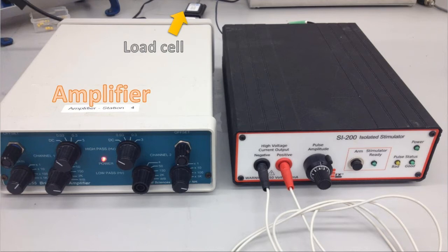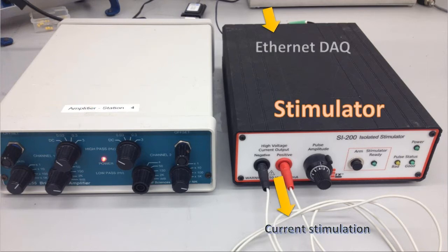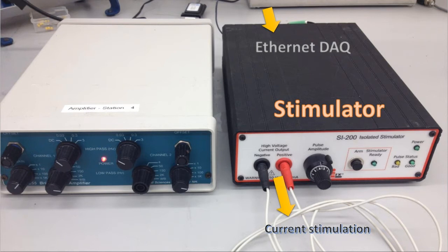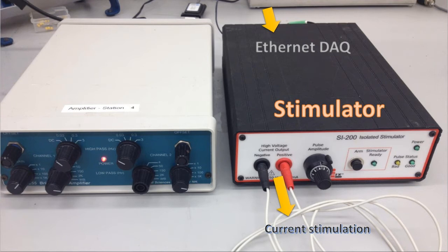We will use a current stimulator to induce muscle contractions in the frog. This stimulator works by outputting a known current pulse from leads on the front panel of the device. The stimulator outputs a very short pulse — just long enough to trigger an action potential.